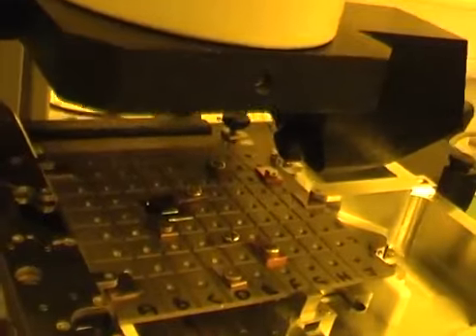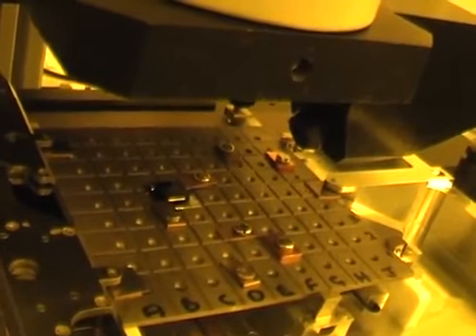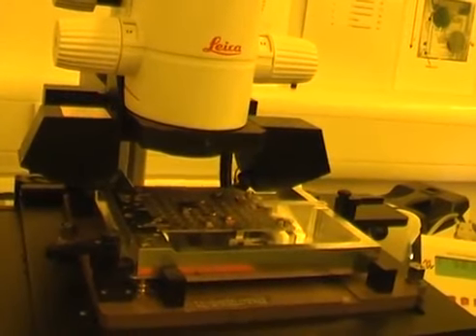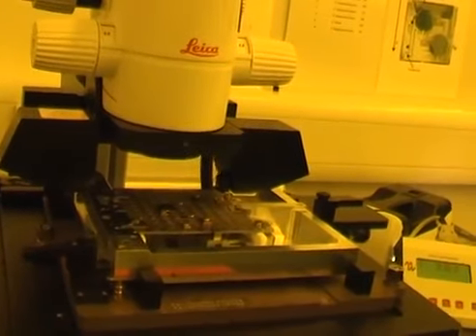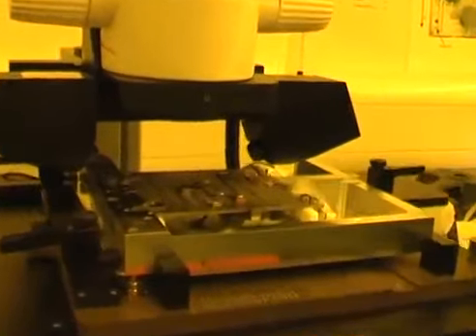What I'll try and do, therefore, is adjust the overall height of the sample to be correct, but there's really nothing I can do about the tilt, and I'm going to assume that it's caused by the gluing process, but that's difficult to measure because the laser won't work on the underlying silicon piece without adjusting the height pieces.